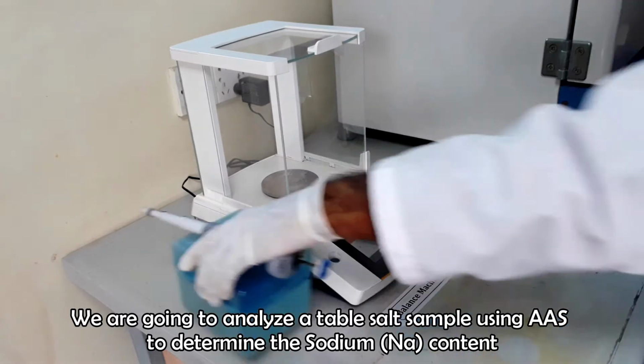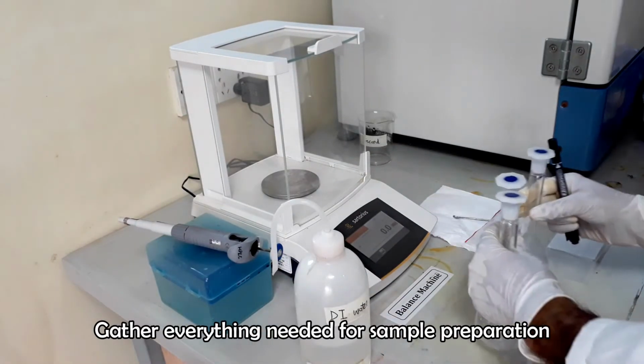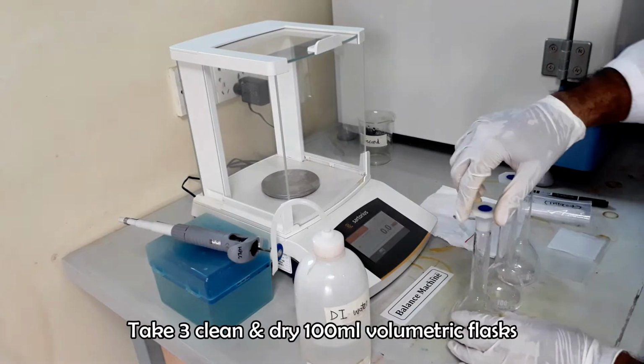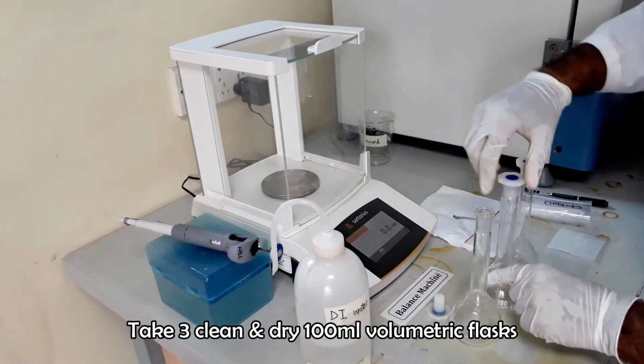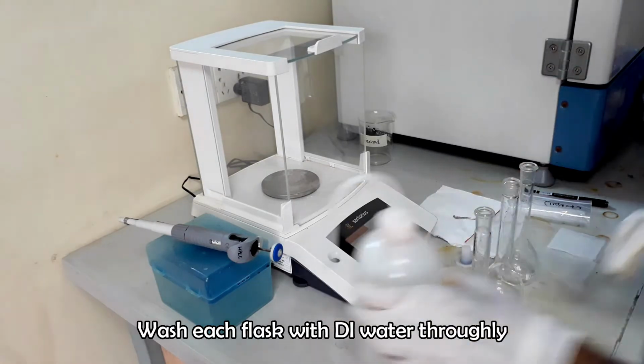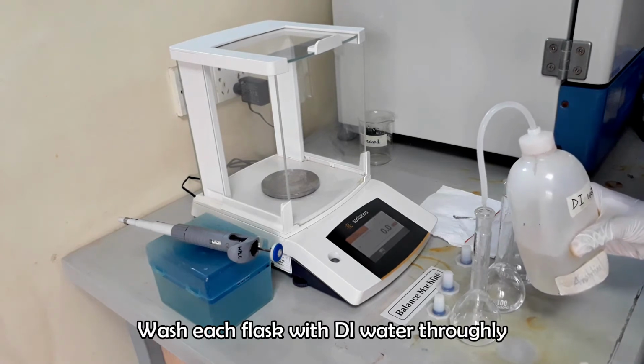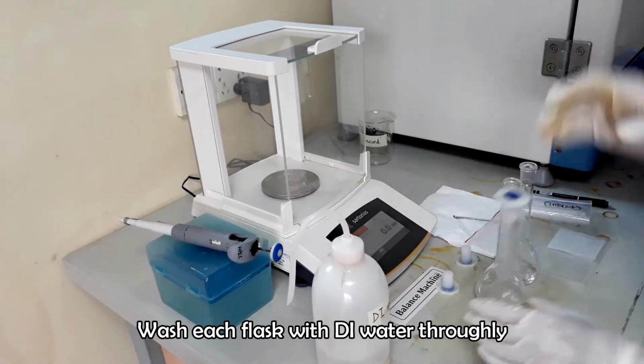In this step we will prepare our table salt sample. Gather everything needed for sample preparation. Wash all of the flask with deionized water.